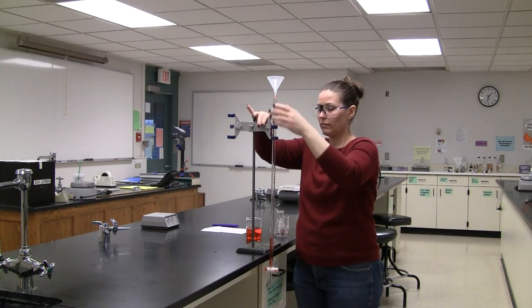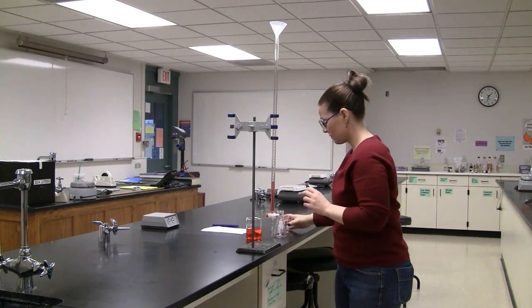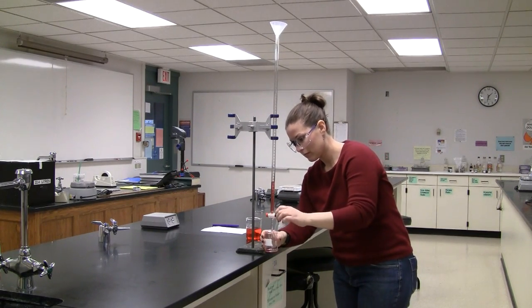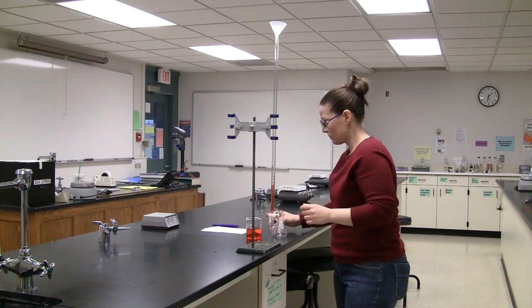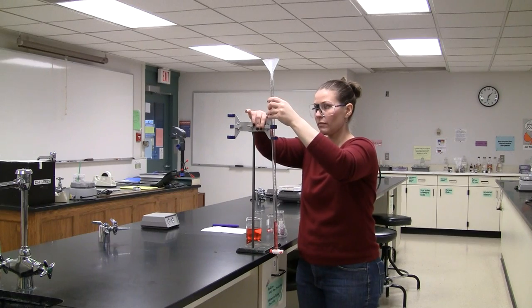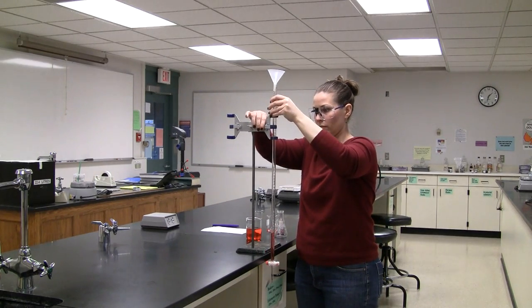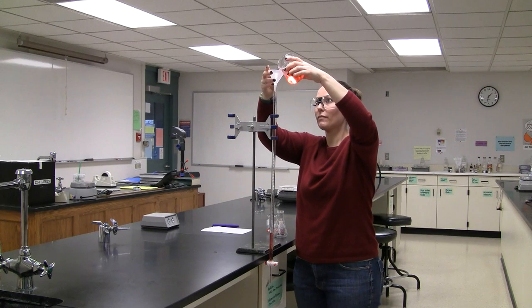Then drain some of the liquid to fill the burette tip to ensure no air bubbles are present. Add the volume of liquid you will need for the experiment. It is not necessary to fill the burette all the way.